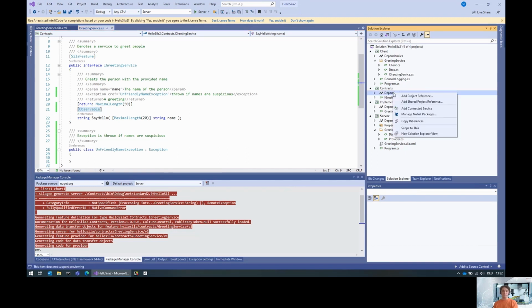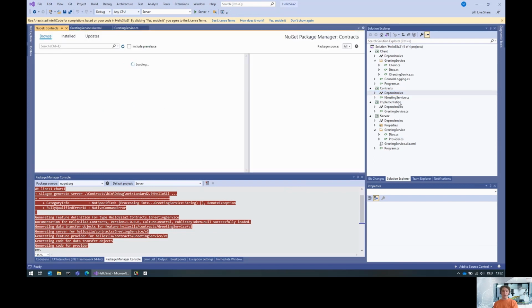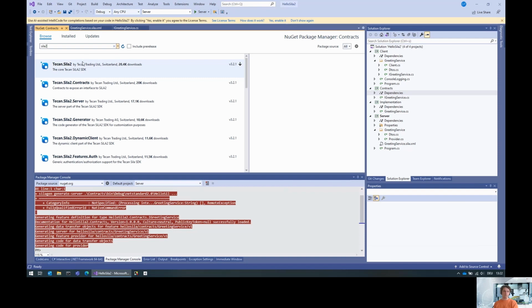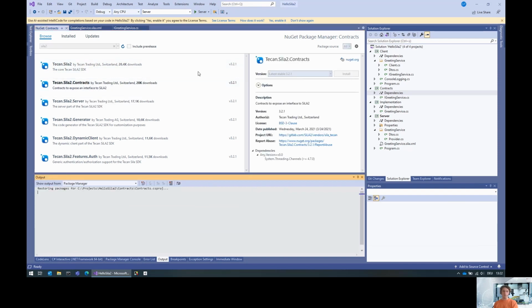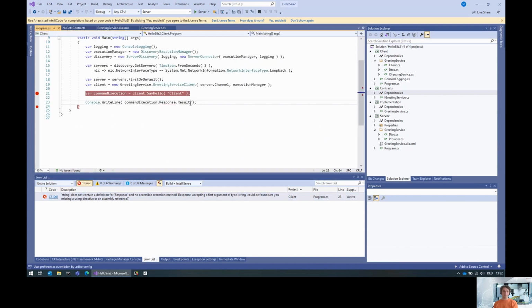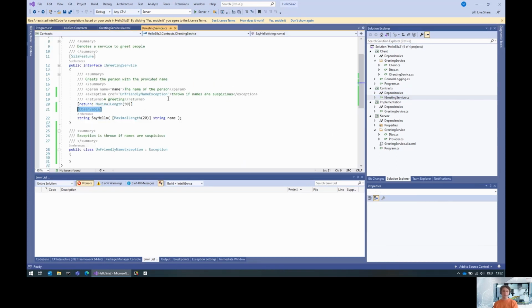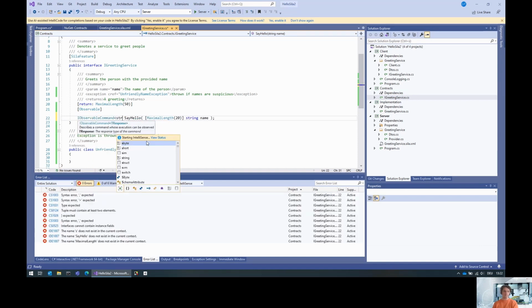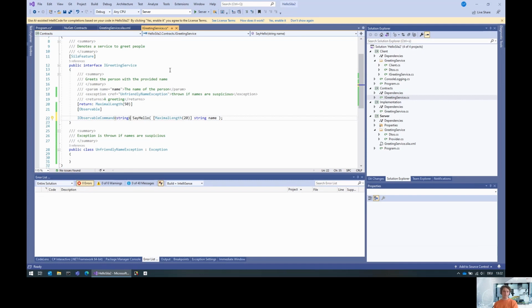The better way is to also put the SiLA 2 contracts into the contracts assembly. You can just search for SiLA 2 contracts and install that to the contracts project. And then this allows you to say, okay, this is an IObservableCommand of string. Hooray.